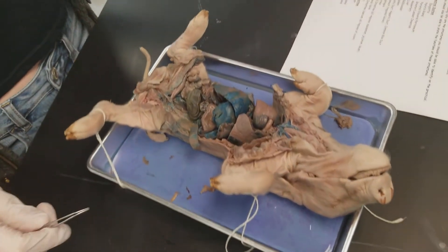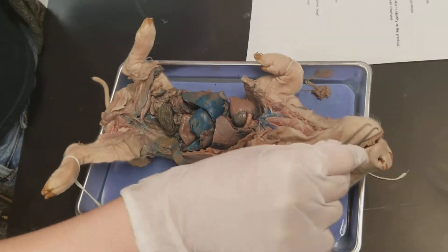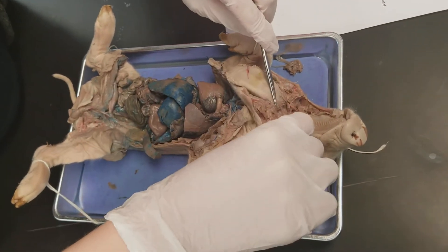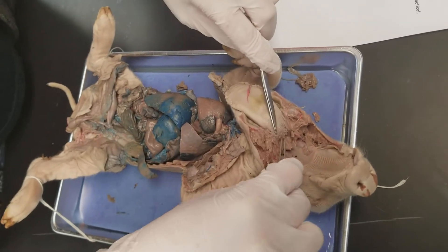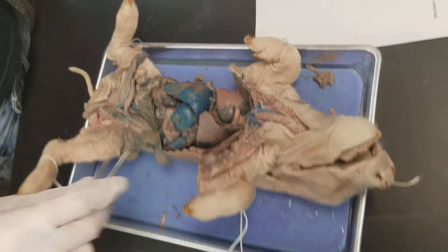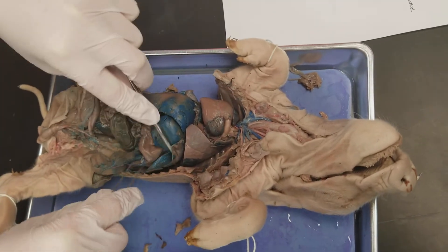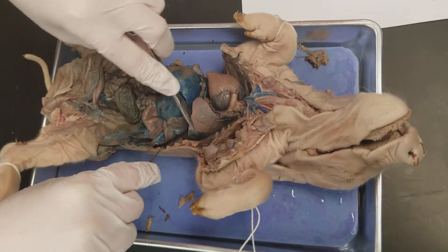Digestive system! So the digestive system starts up here with the epiglottis, which you can see right here. And we did not find the parotid glands, and the peritoneum — we just removed most of it, although you can see some still attached on the sides.